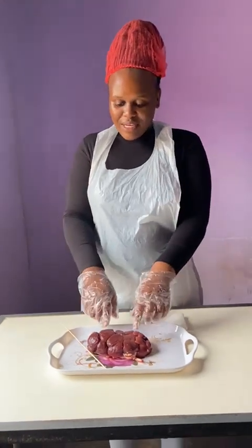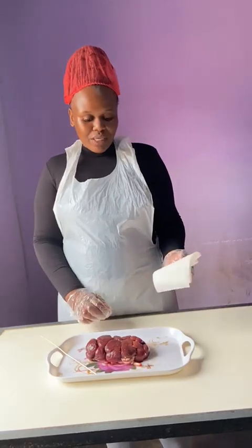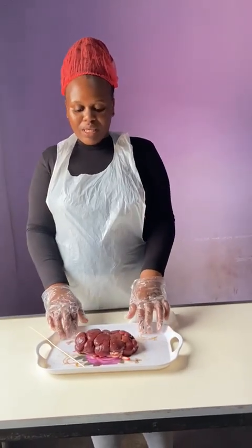The materials that I will be using are the kidney specimen, the wooden stick to point at the internal structure of the kidney, the blade, as well as the paper towel to wrap up the mess. And I will be using the plastic tray, as it will be the area where I will be dissecting my specimen. Before I begin, I will follow the important safety measures.